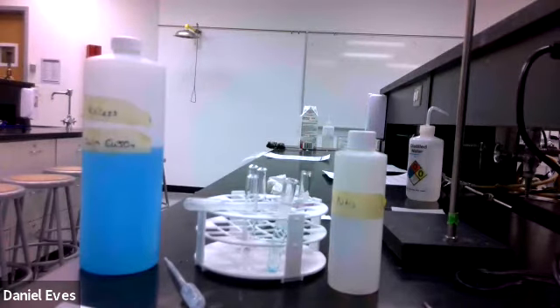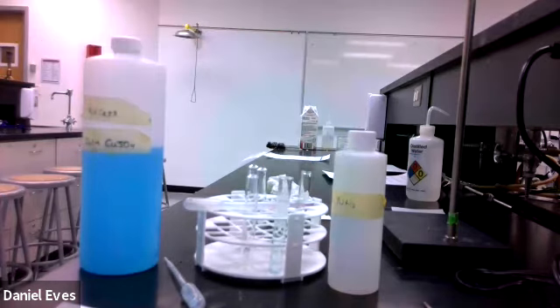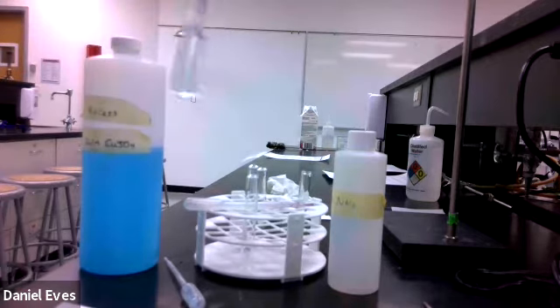So what's going on? We're shifting the equilibrium back and forth, and the equilibrium that we're having is the copper making the compound of copper hydroxide and copper ammonia complex. And as we add the acid, it's reacting with the ammonia to make ammonium, the hydroxide to make water. And so as it becomes more acidic, we lose those compounds.